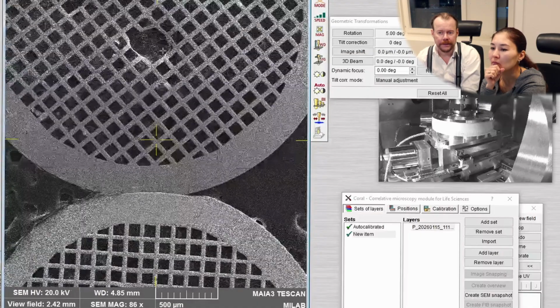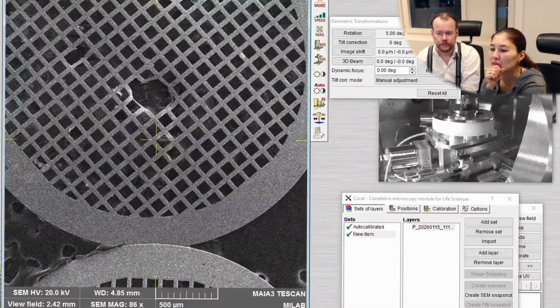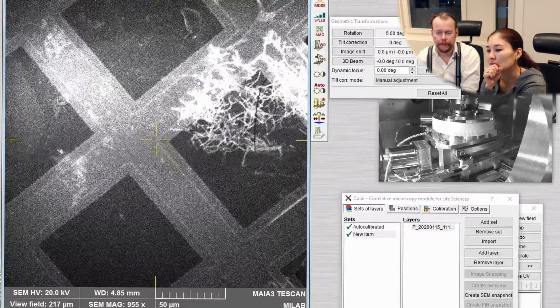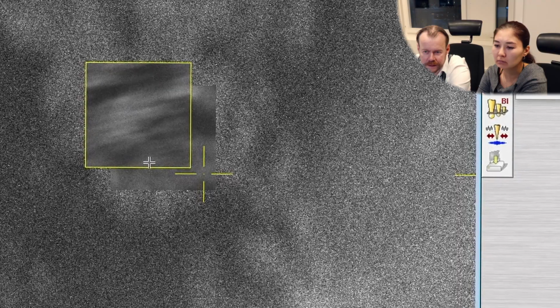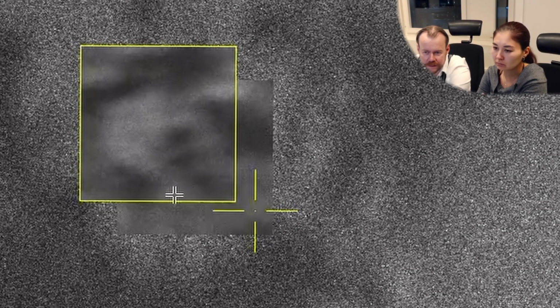So now we are looking on the back side, the grid that's flipped back, and this is the one that is facing in the right direction. So let's go back to high resolution now. Here you see lines, right? Zoom in even more. You see the lines. Now the lines go in the other direction. So we want to find the true focus, which is there.